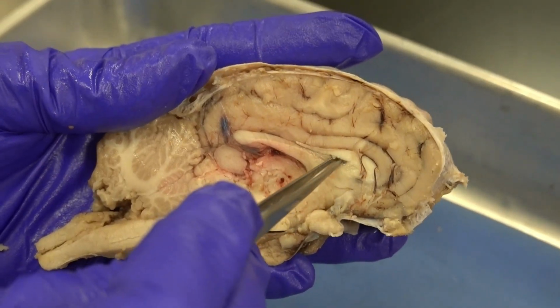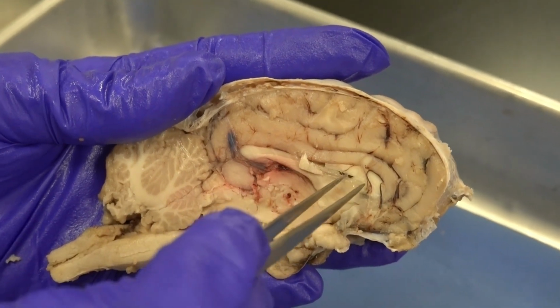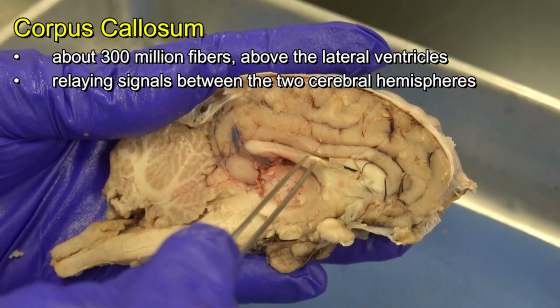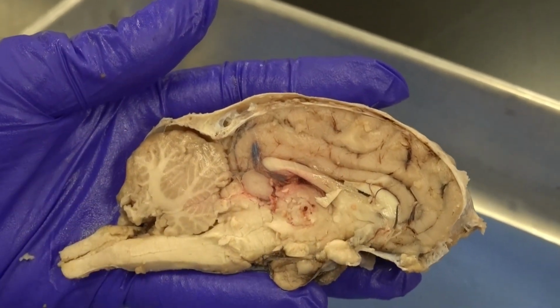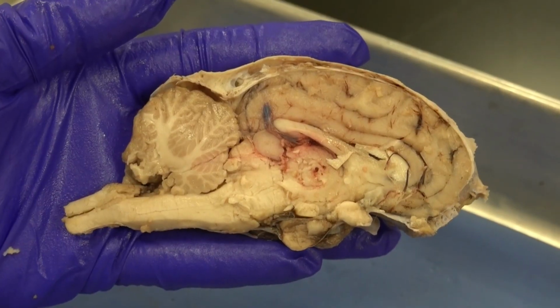And as I mentioned, inside the cerebrum, in each cerebral hemisphere, we look for one of the lateral ventricles, which, like any other ventricle, contains the choroid plexus. So this was a very short summary of the structures that we can see in the brain. I hope you find this helpful.